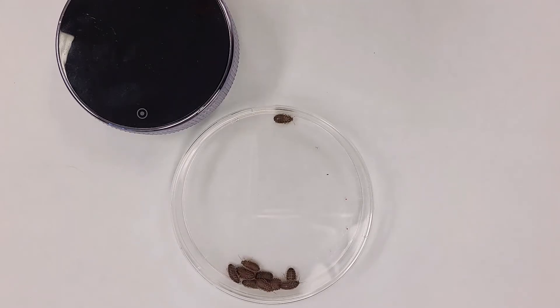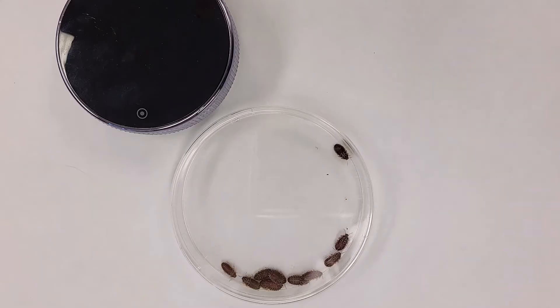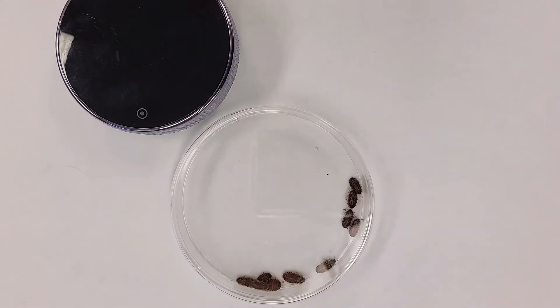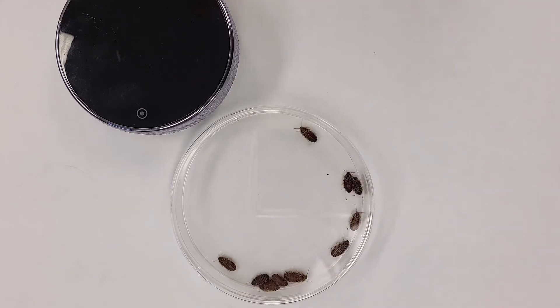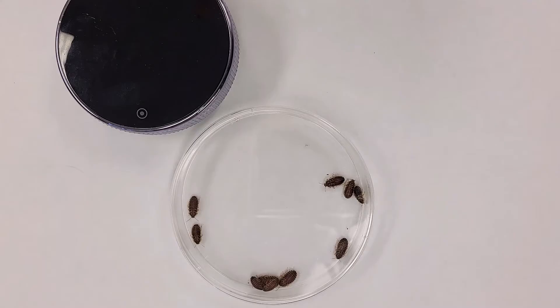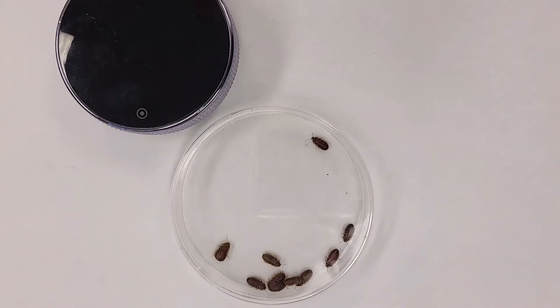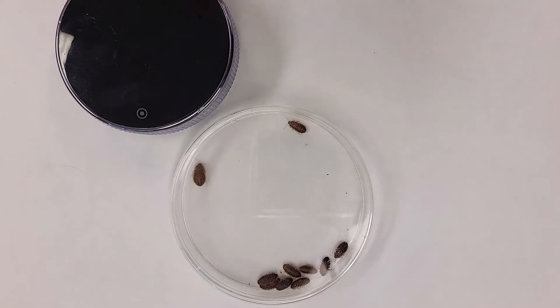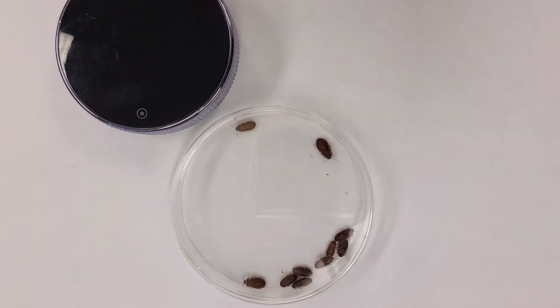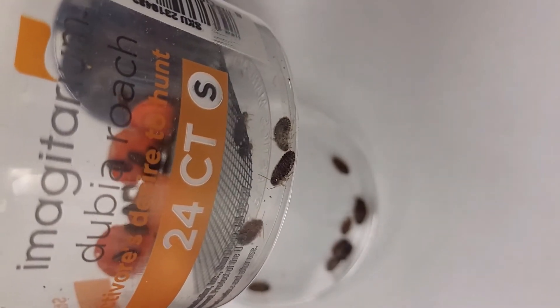In this lab we're going to do the animal behavior lab and we're going to observe some organisms and then we're going to put them in a choice chamber and see if they have a preference for one condition versus the other. The first part is just observing the organisms for a little while, and normally this lab is done with pill bugs but today we're going to use these from the pet store.